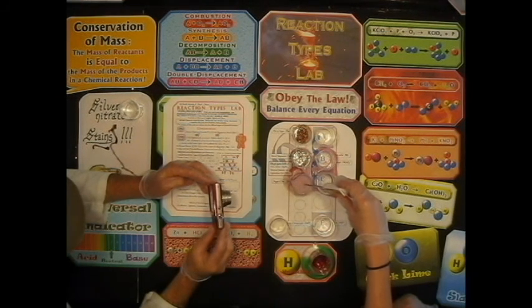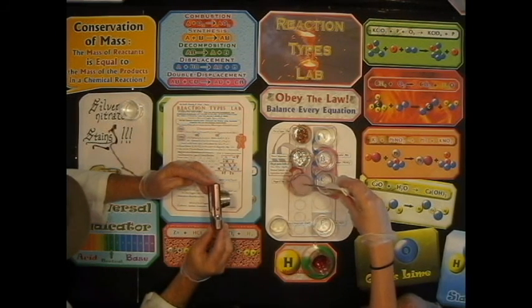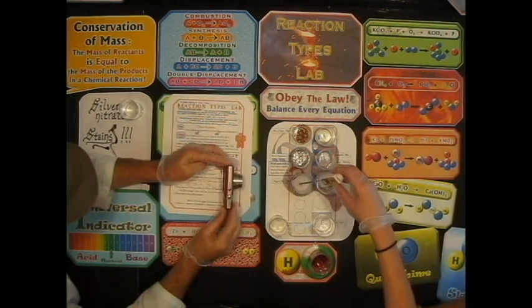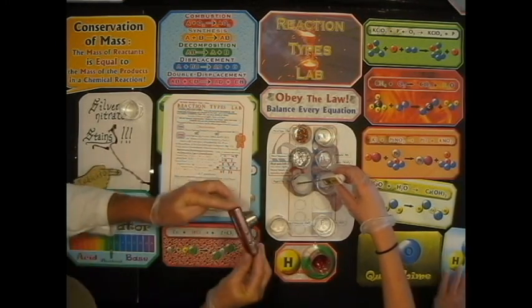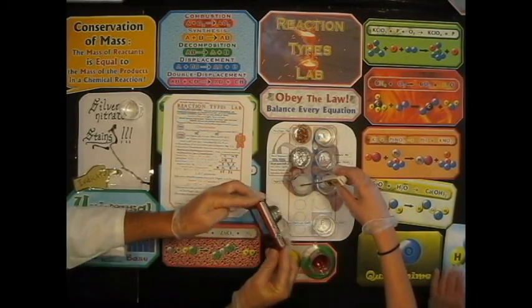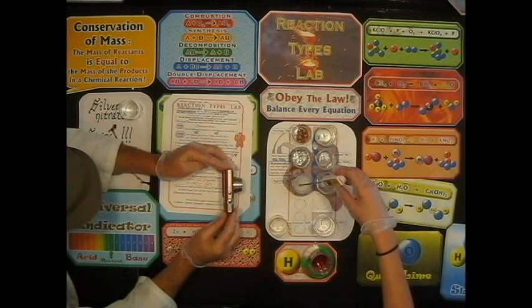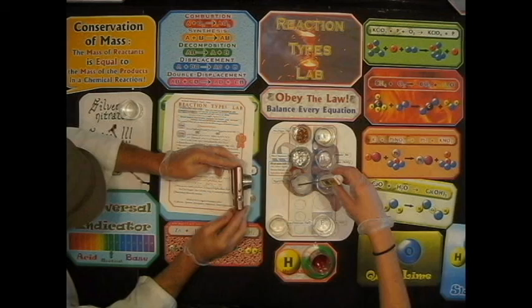The only drawback is this could damage our white background, but if we need to, we'll get white placards. 42.9 Celsius. I know, it just keeps going up. I'd say like 76. Oh, has it gone up that much? Yeah, it keeps going up. Wow, wow, hang on. So this is a good one. It's really going. I think this is in focus. Looks good. Let's see if we can get a little closer.